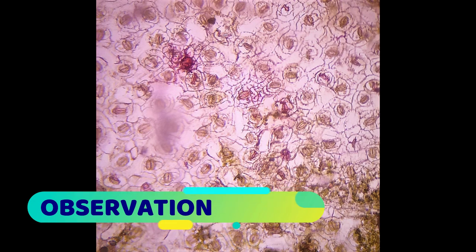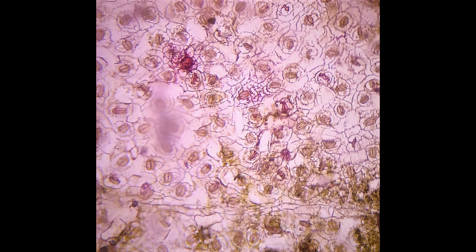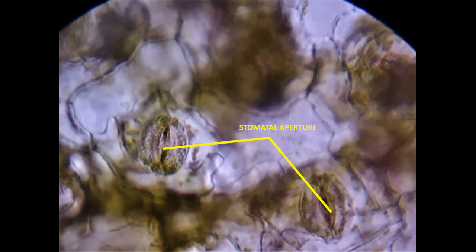After completion of the procedure, now I will observe my slide under 10x magnification, and after that I will observe my slide under 45x magnification.